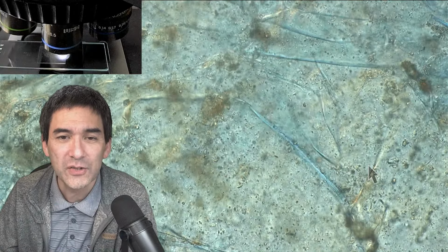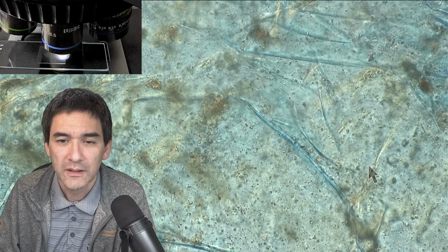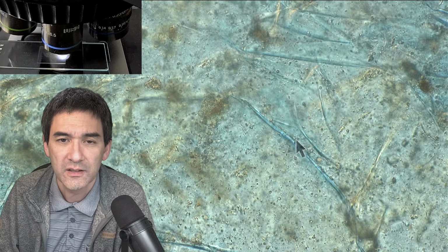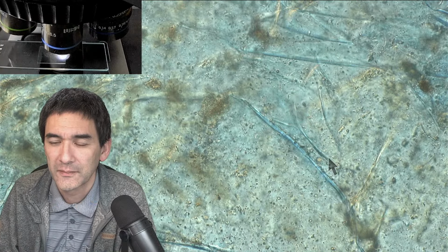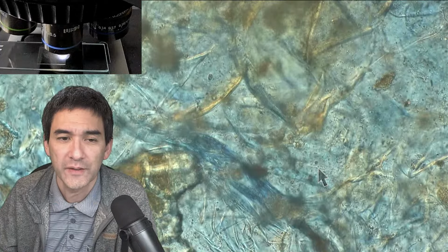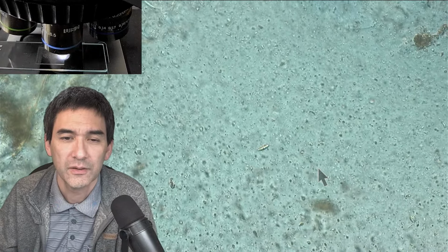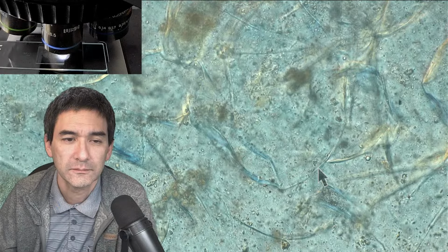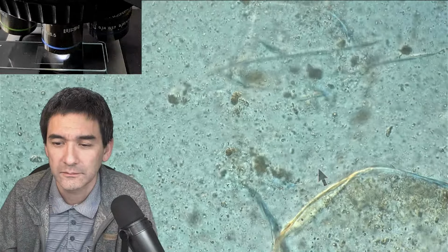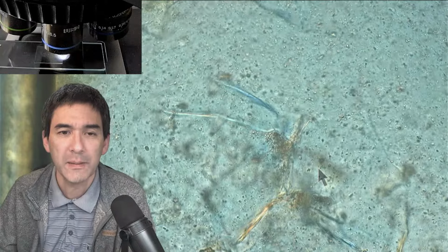And those things that you see over here that look a little bit like folds, yeah, these are actually the cell walls of cells. Yeah. So structural reinforcement, that's correct. Yeah, a whole bunch of things here. So, yeah, it's spreading by capillary action.